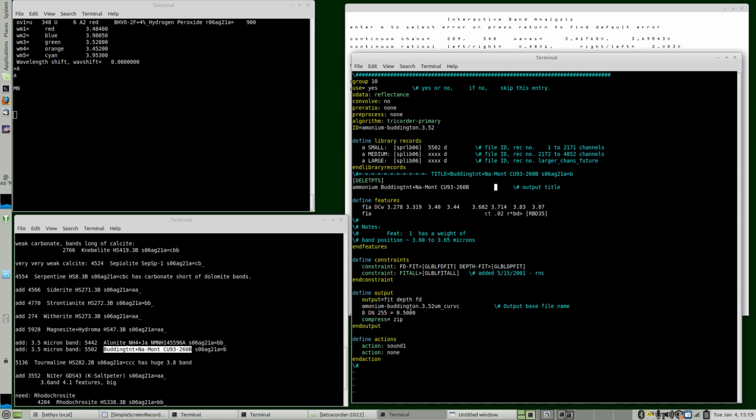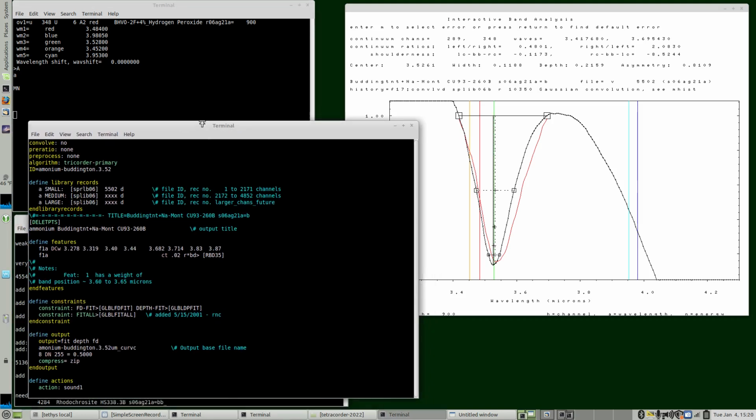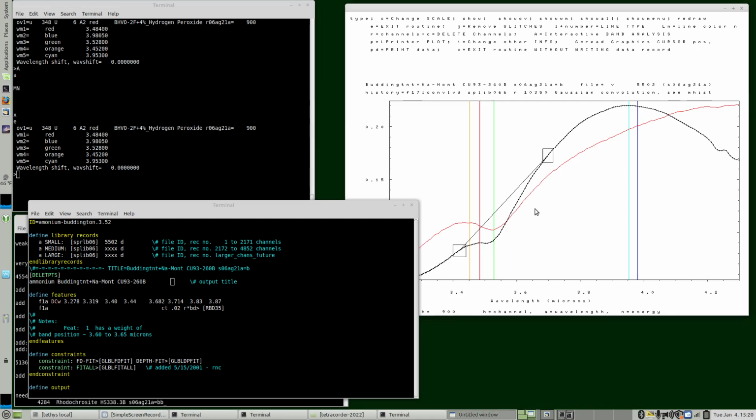of course, we could decide on things like how we scale the output DN in an image, if we need other actions, what our thresholds are, and our wavelength continuum intervals. So probably most important, let me move this down a little bit and move it over here so we can see things a little better. Okay, so our continuum interval, it looks okay right here. I like those. They're not much different than these.